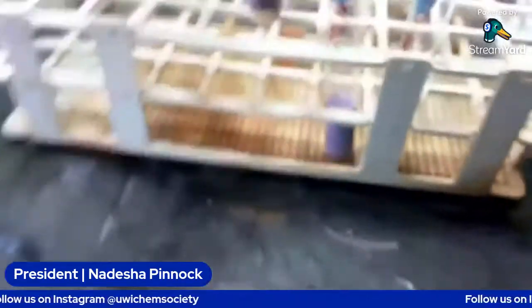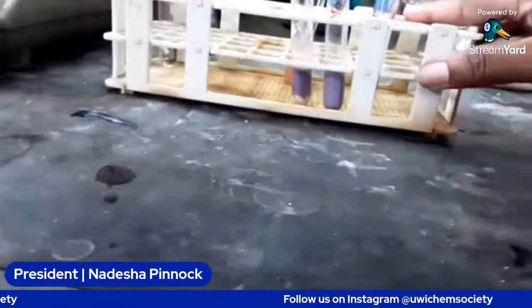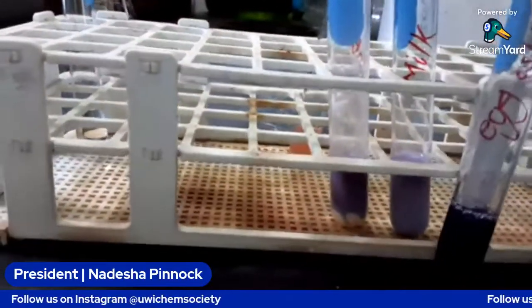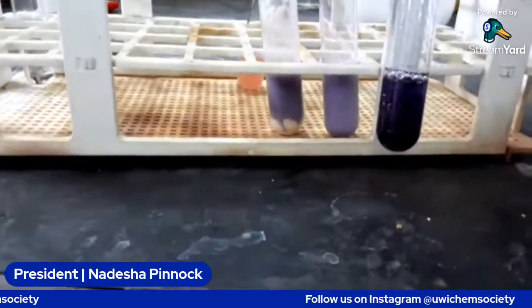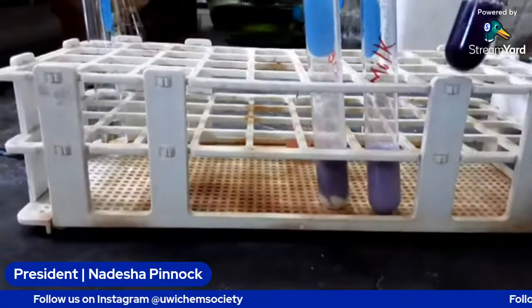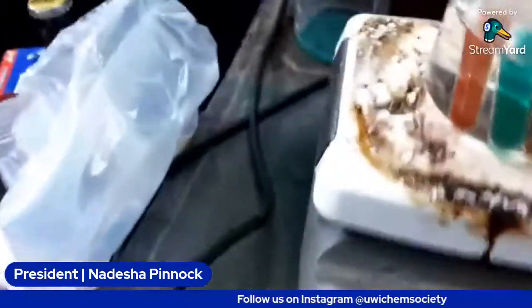All right, so those are the 3 of them. So we have the milk, and this is the egg white. The egg white is pretty bright, but of course it was transparent before. And then this is the milk, and then we have the cheese. So pretty simple.